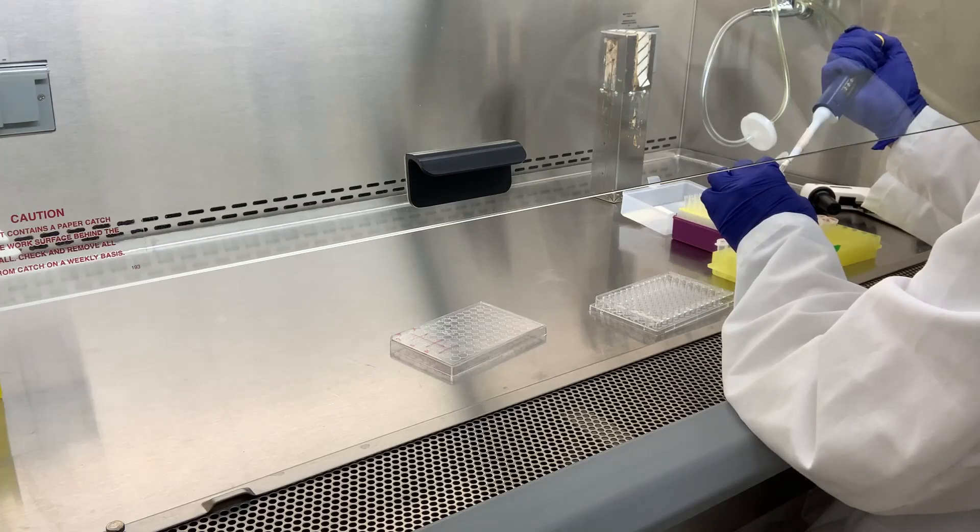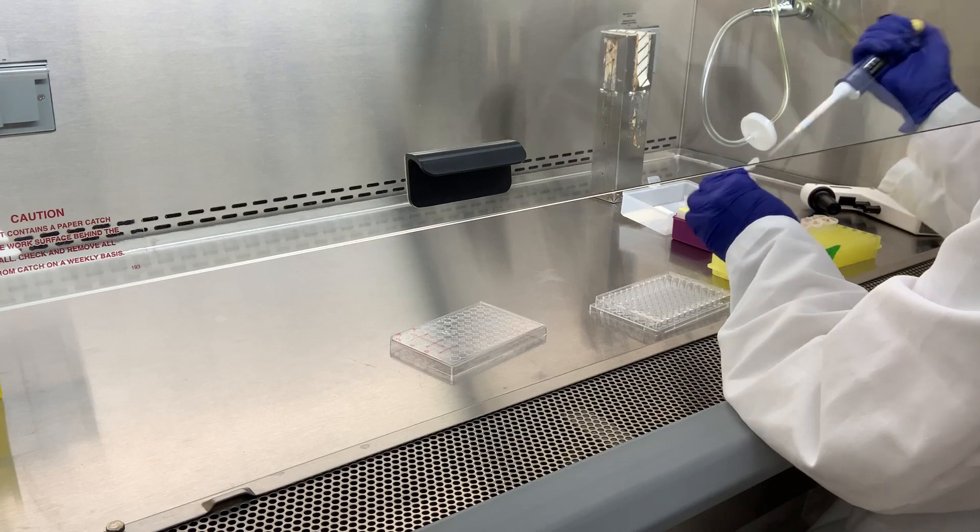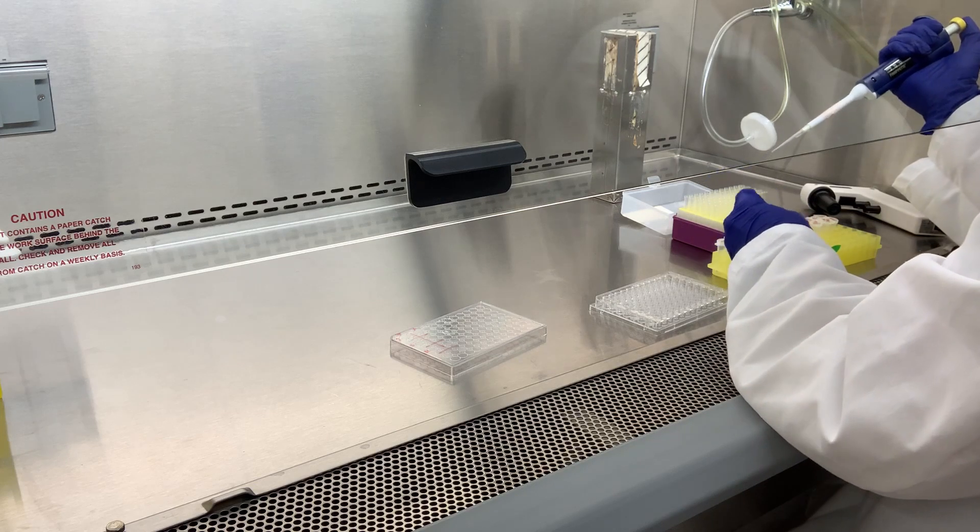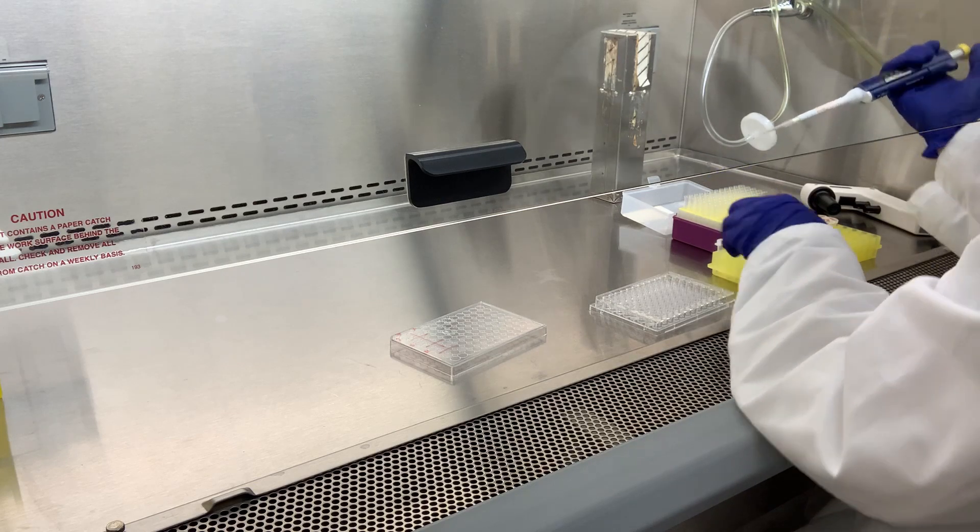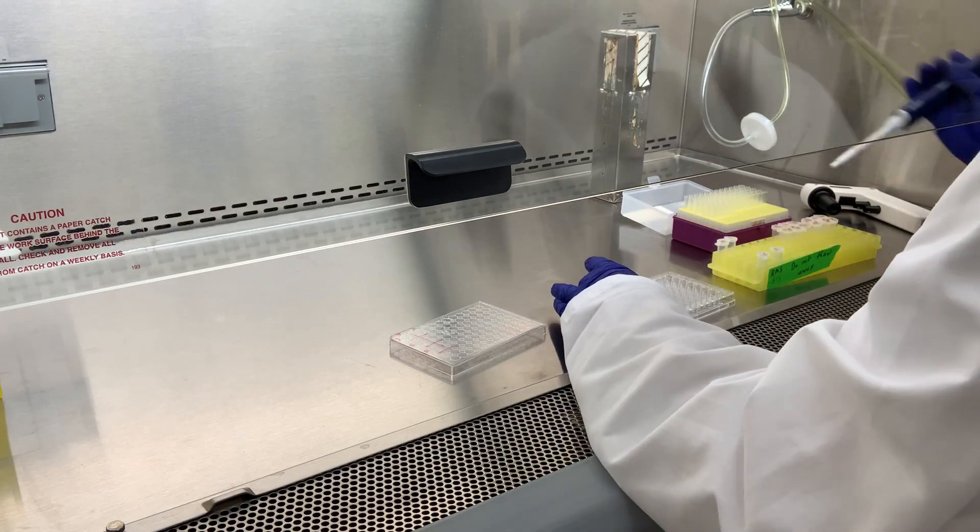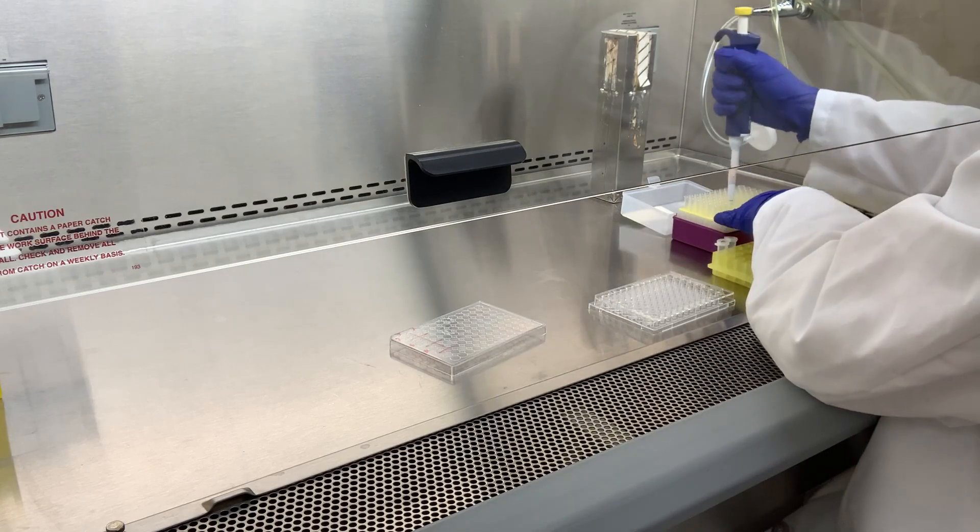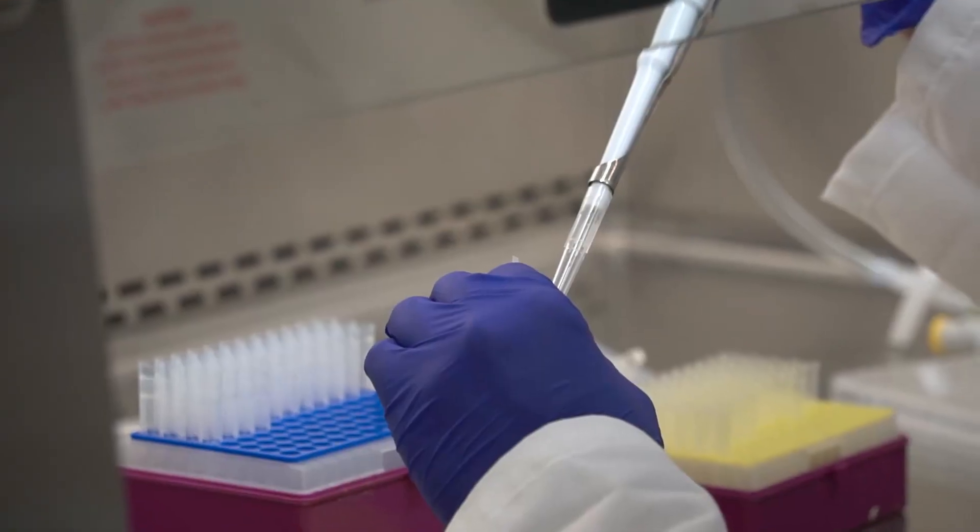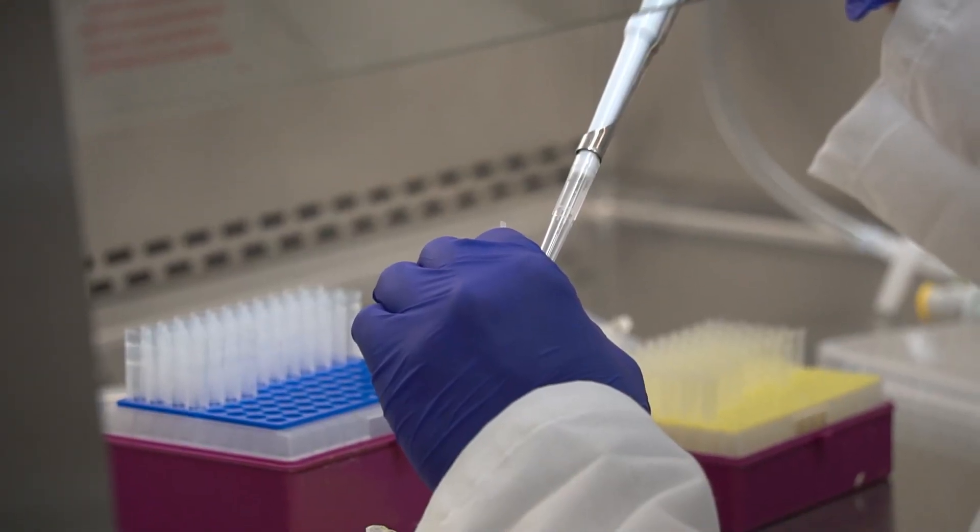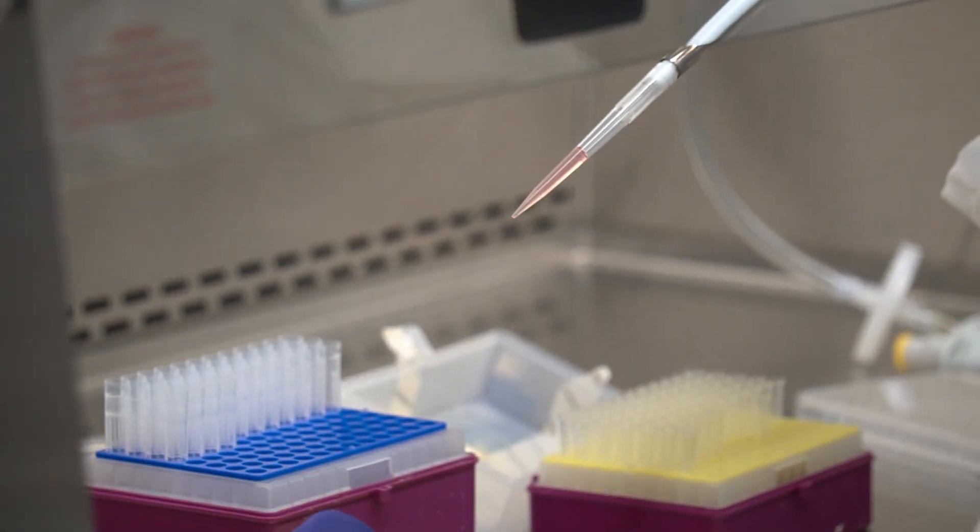To start off, we first prepare a 96-well plate with the appropriate media. The media is currently unconditioned. If this is a dose response study, we will go ahead and load the appropriate dose in each well.